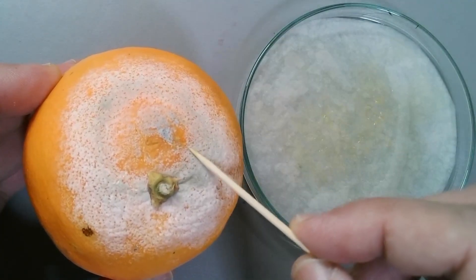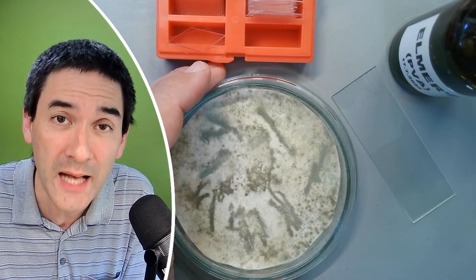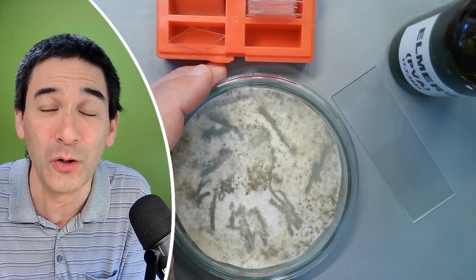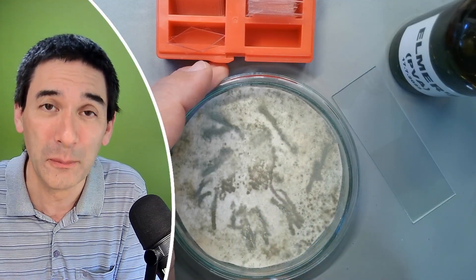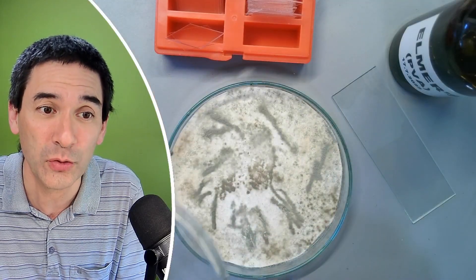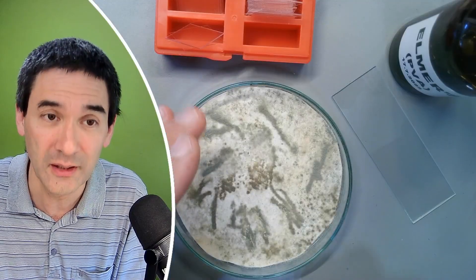What I've done is I made basically a filter paper, cut out the filter paper, added a little bit of orange juice, and then I transferred some of the fungus onto the filter paper. After a couple of days it really started to grow very intensively and then it started to form those spores. I made a separate video on when I did that.